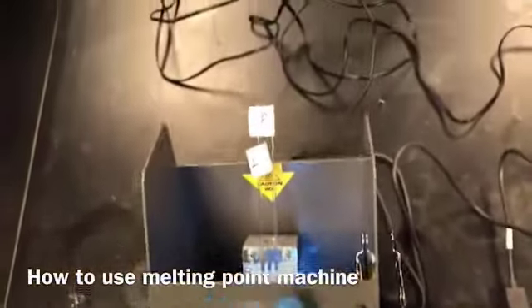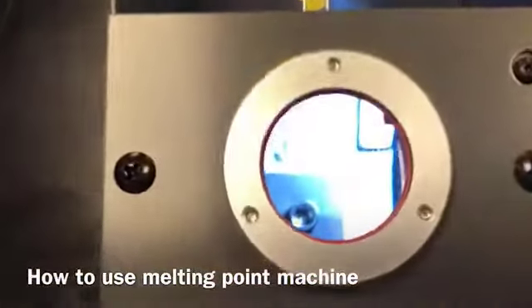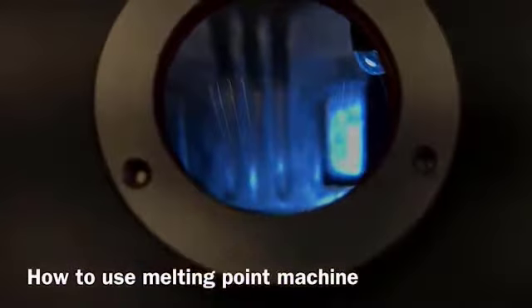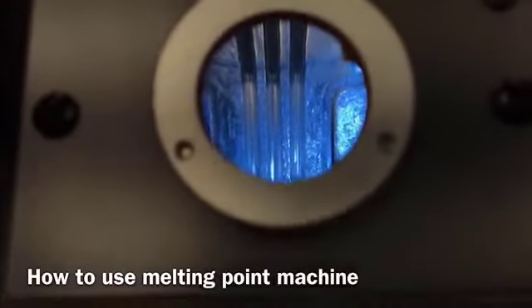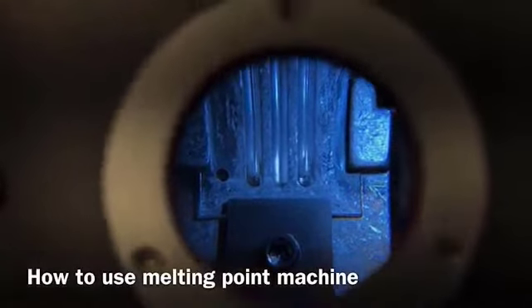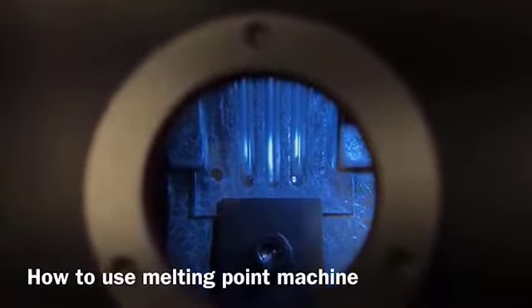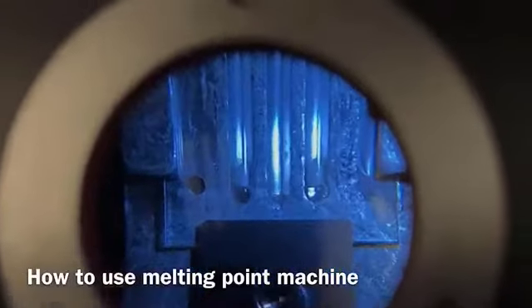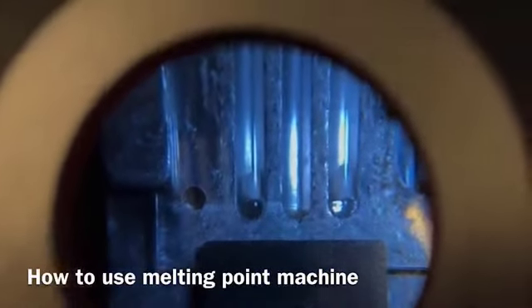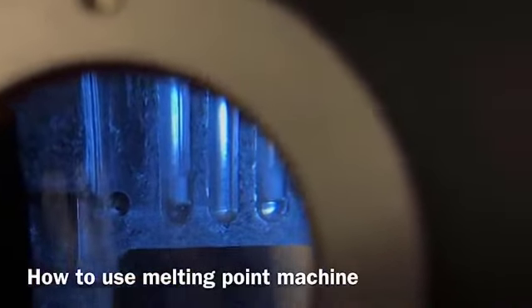Right, and this is basically the eyepiece, or you can say the magnifying glass. From here you can look at your samples. I'm not sure if you can see clearly. The capillary tubes are visible here, right, with the samples in them. Since the temperature has not reached the melting point, you would see just the solid samples as you placed them. And once it started melting, you would see the liquids in there.